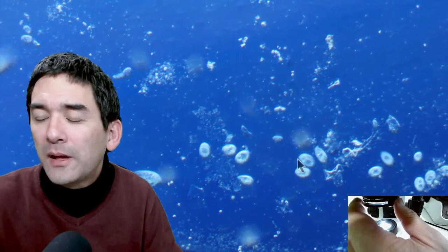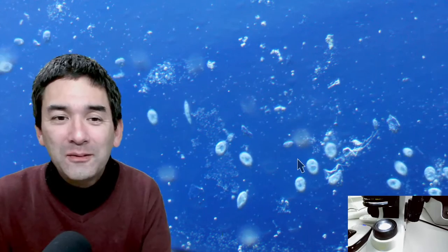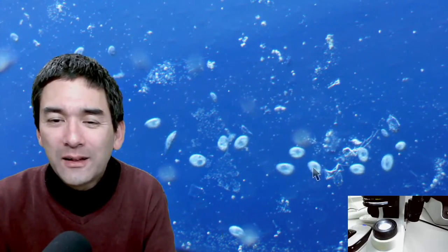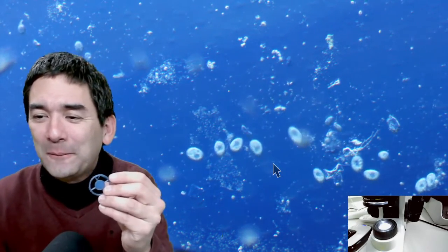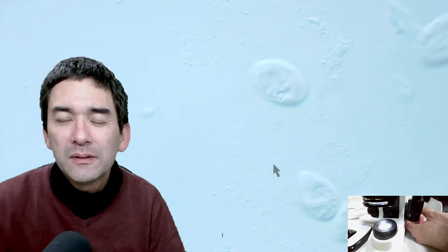A viewer's microscope came with blue, red, and yellow discs — just make sure that if the disc has no openings on the side, everything is going to be the same color. If you want objects to be bright or white and the background a different color, you must make sure that only the central part is a different color than the outside. Now let's go up to 40x and have a look.